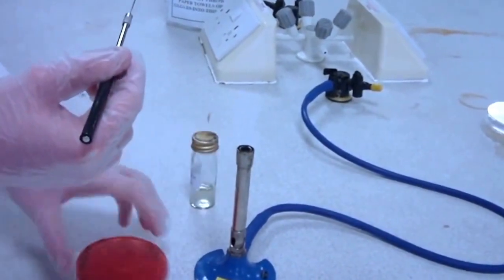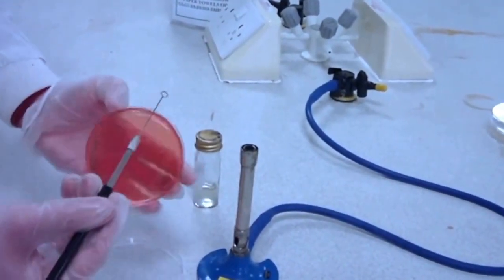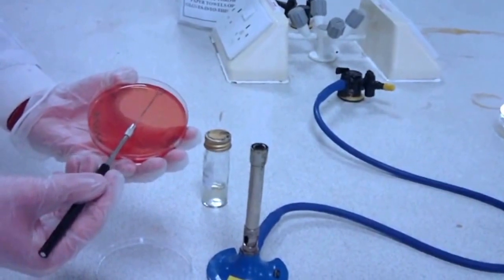Next, partially lift the lid of the petri dish and rub a small circle at your 12 o'clock dot.